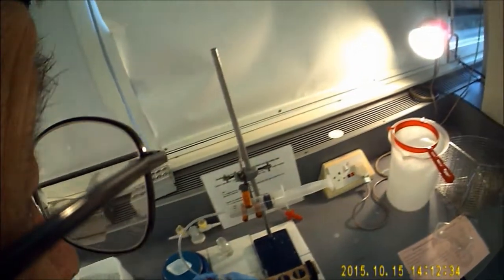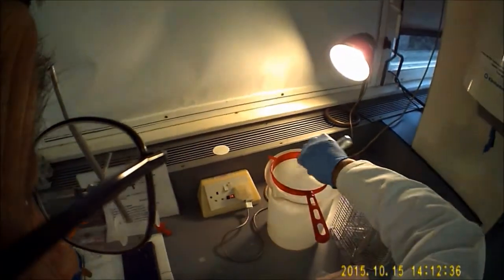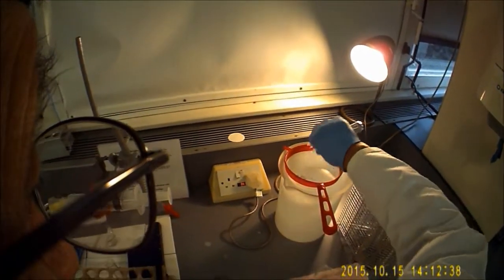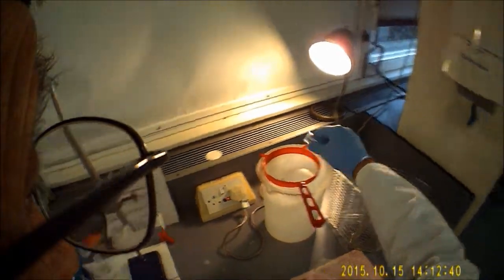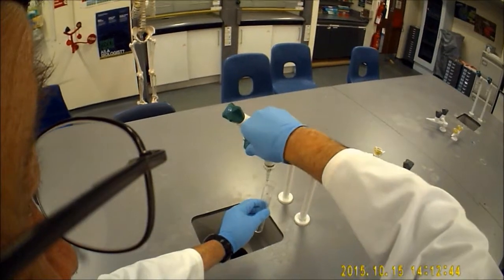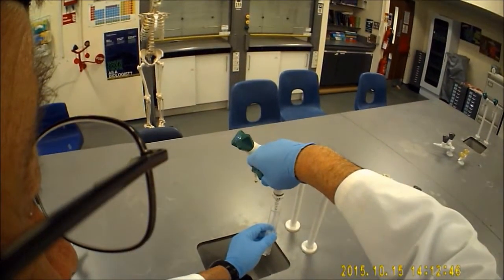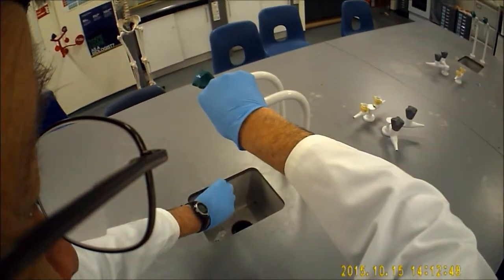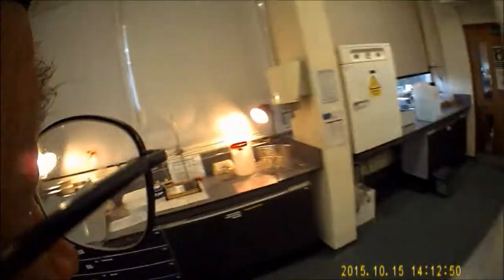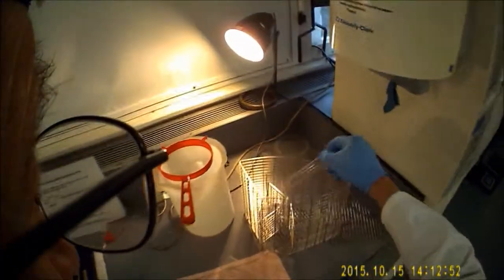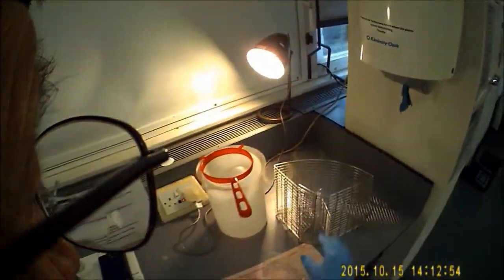What you then need to do is to empty the waste into the sieve, give the boiling tube a rinse with cold water, and place it upside down to drain in the wire rack.